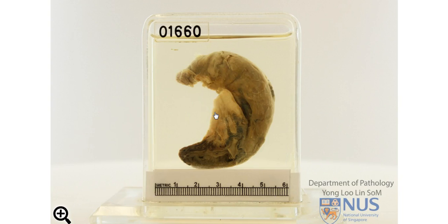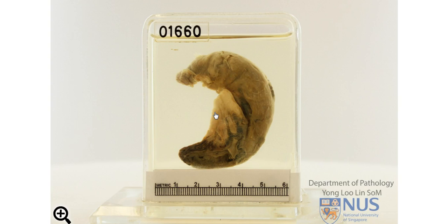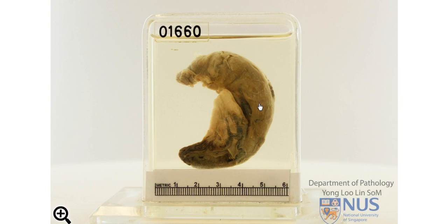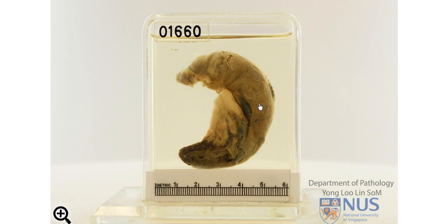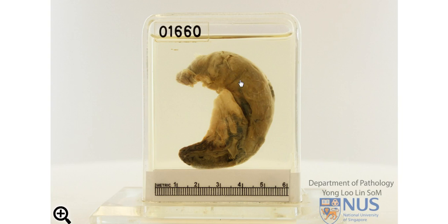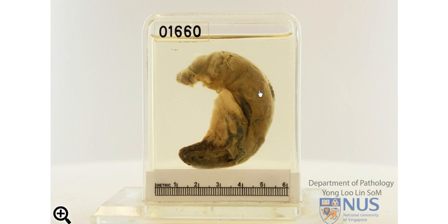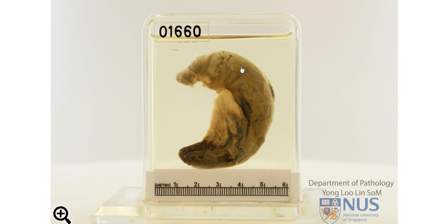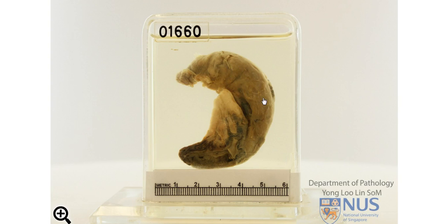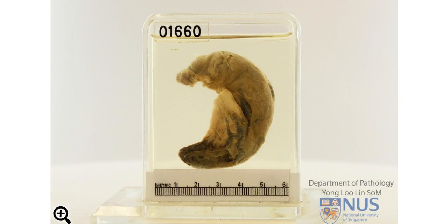So this is a gross specimen showing the features of acute appendicitis. Clinically, the patient would present with right iliac fossa pain, guarding of the abdomen, and tenderness. When the surgeon actually has a look at the appendix, it will be swollen or turgid, and he or she would be able to actually see these exudates on the serosa which is indicative of acute appendicitis.